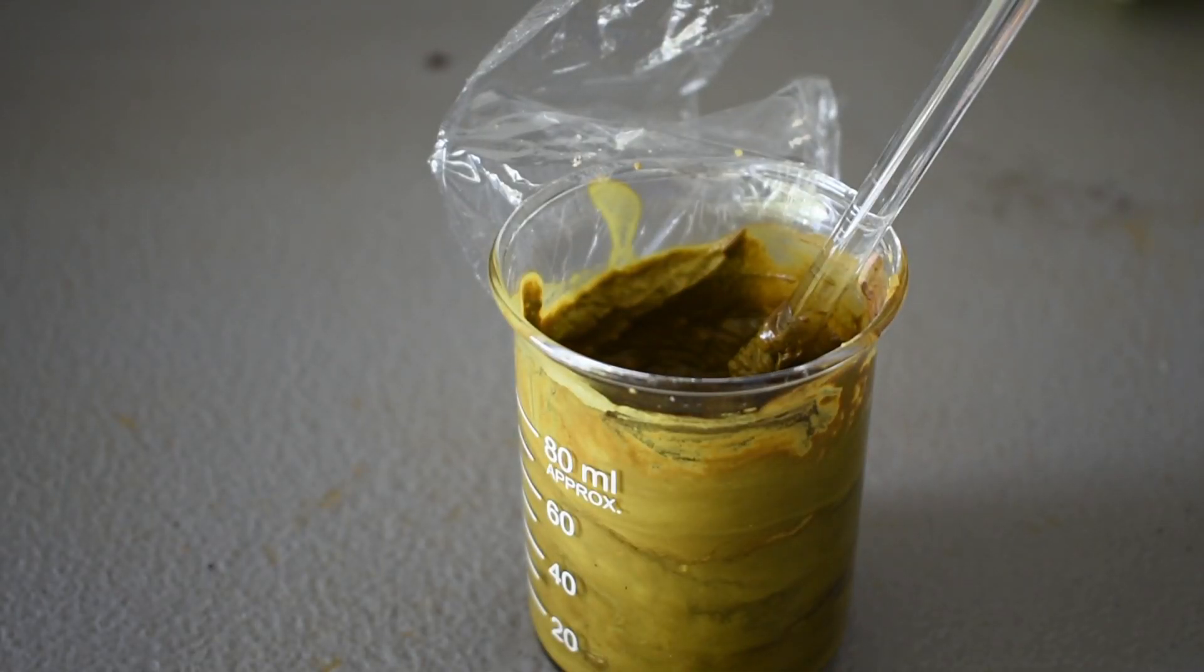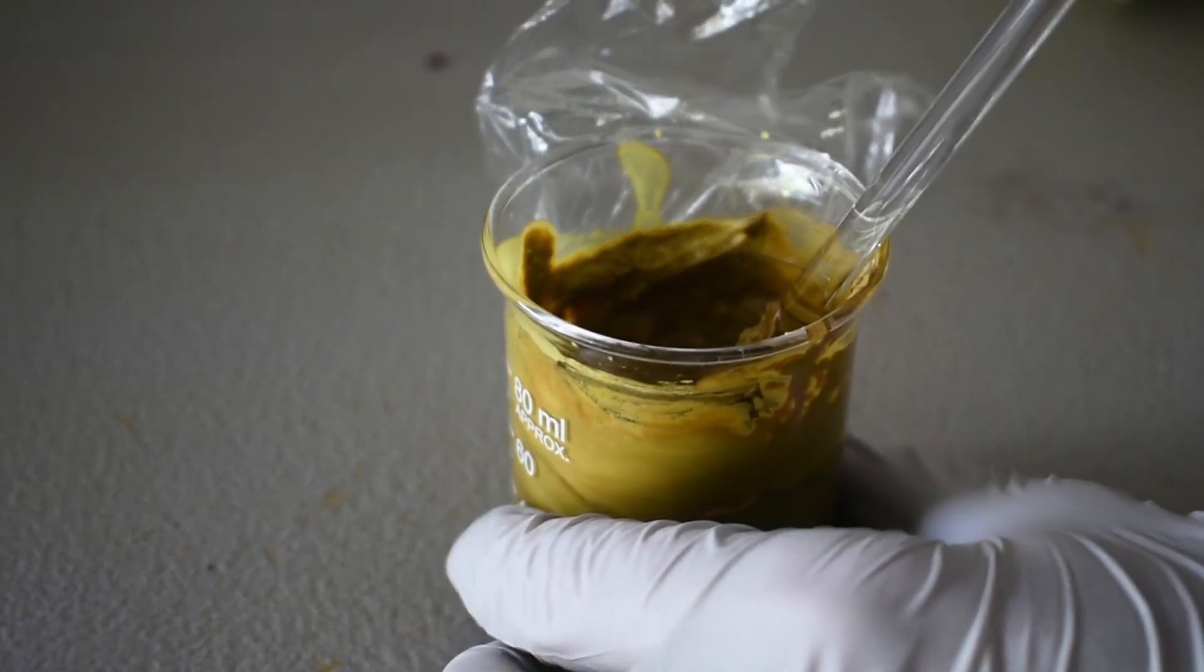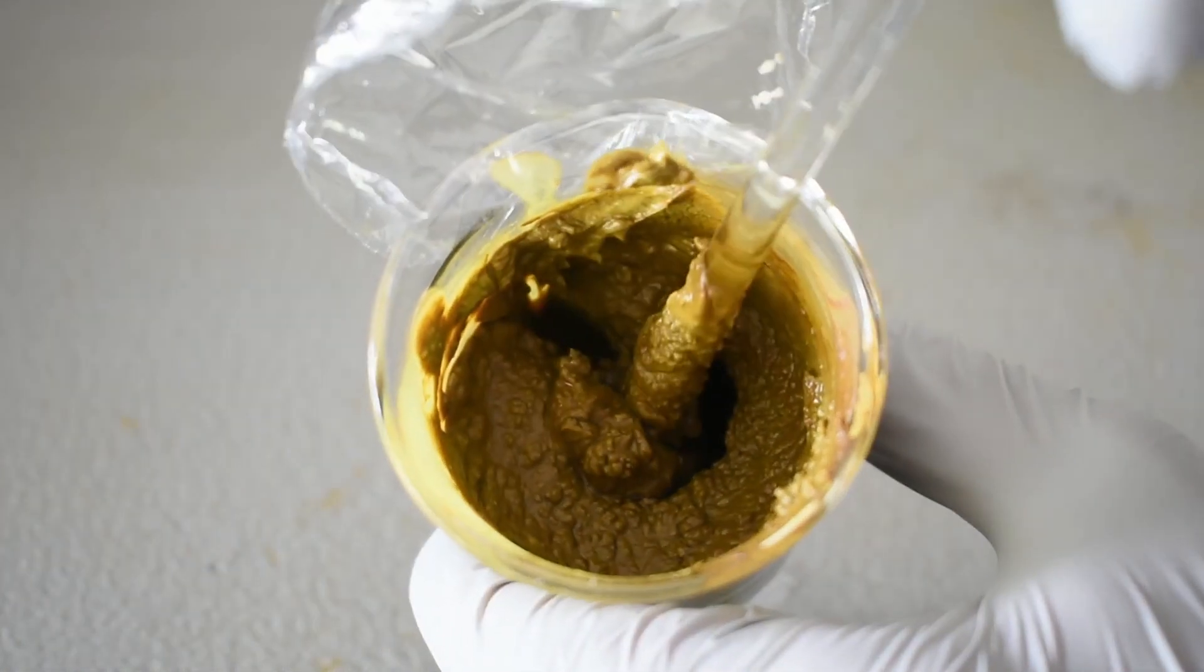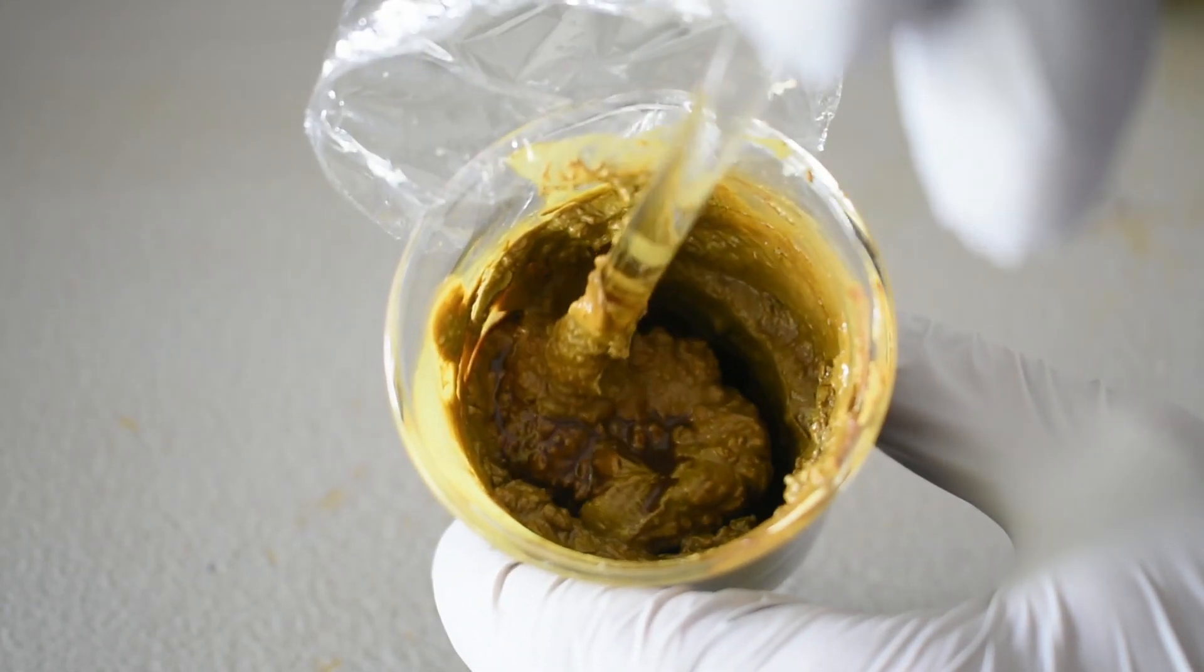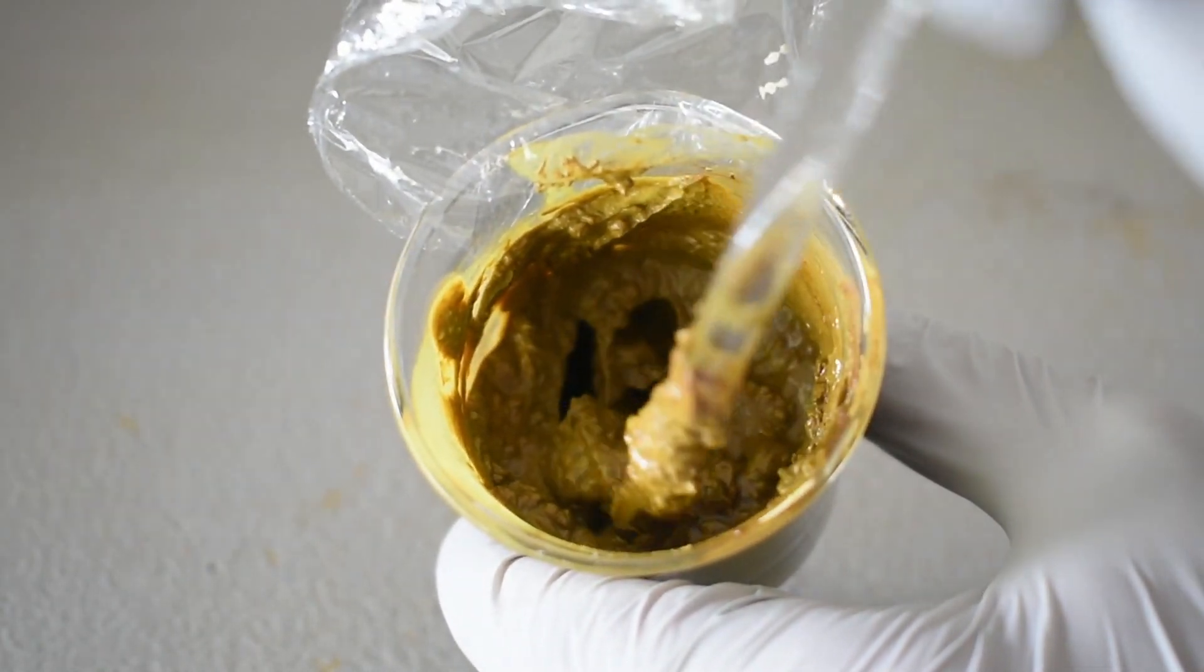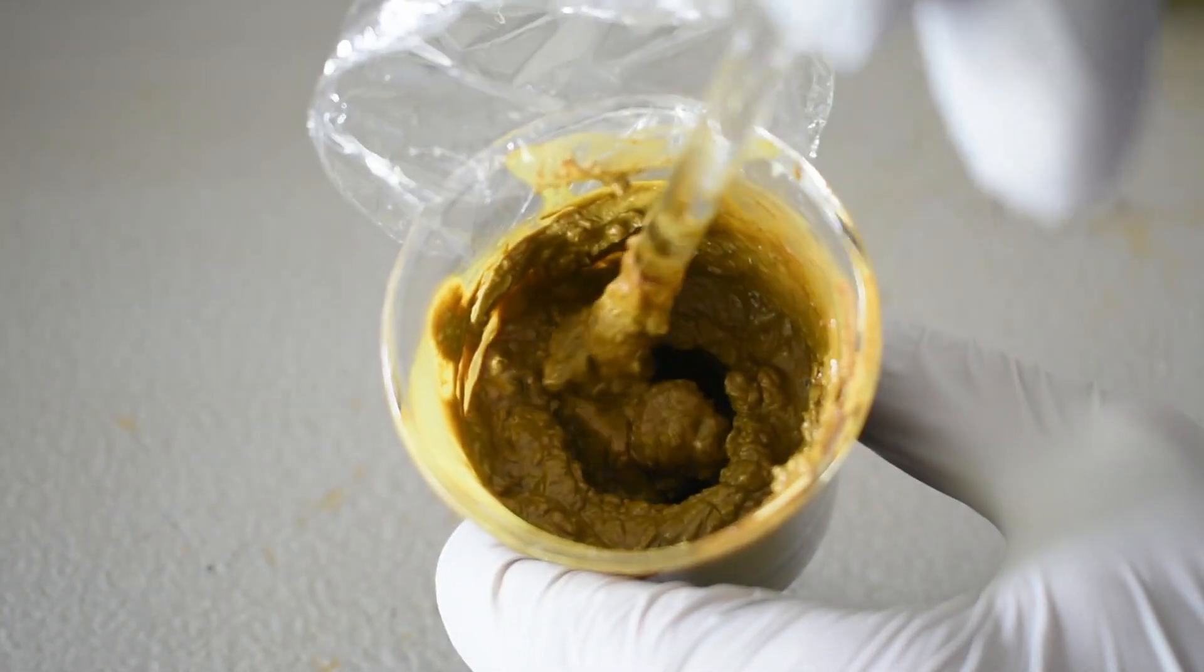So I added some methanol. And there was a significant amount of oxidized stuff underneath. And it turned into this very gross looking brown, yellow paste.